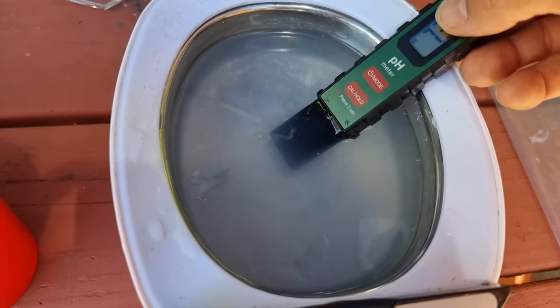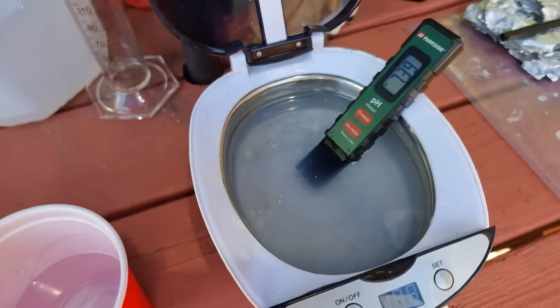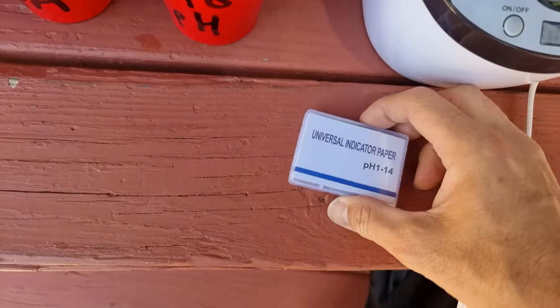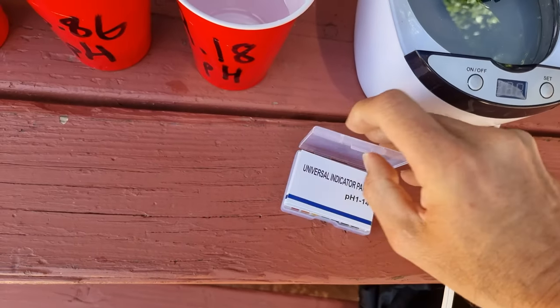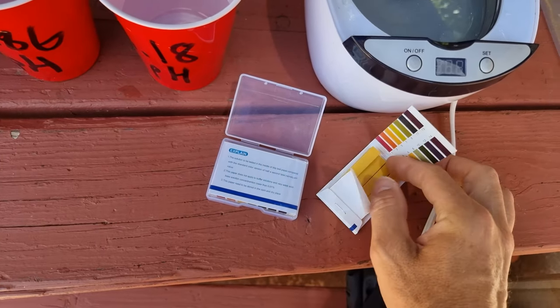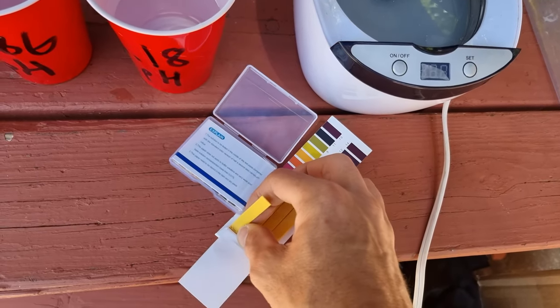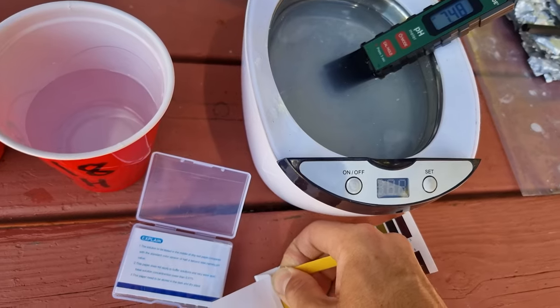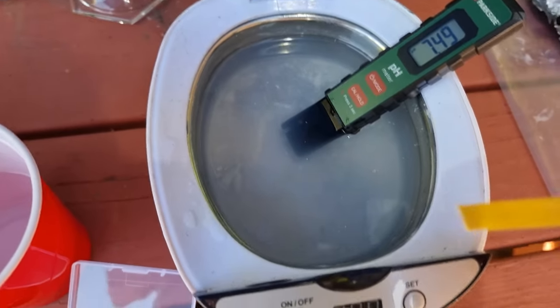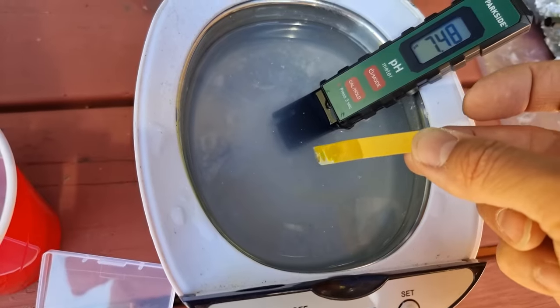We'll leave that on there for now, sitting on that edge. And we'll get some universal indicator paper. Get some of these pH strips out and see what it reads. That's reading 7.48 now. I'll take one of these over there and put that in here.